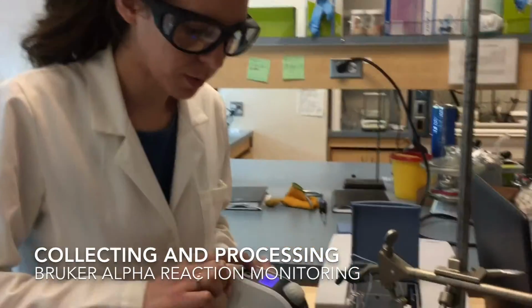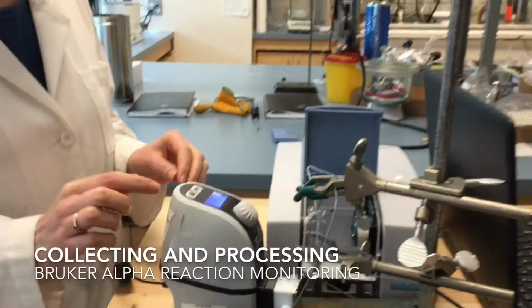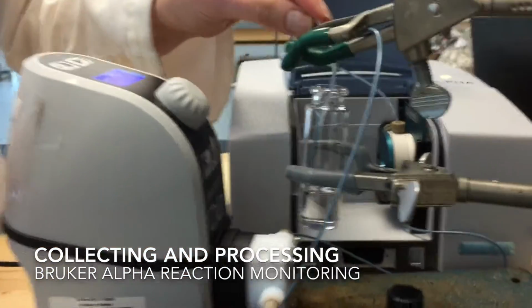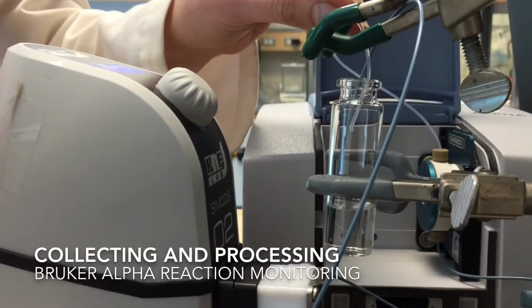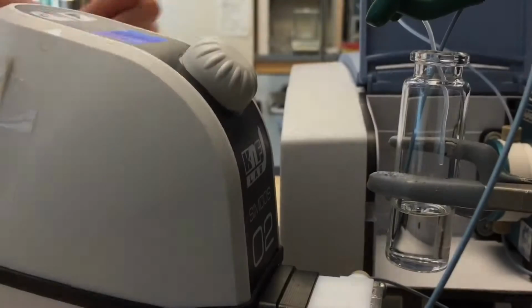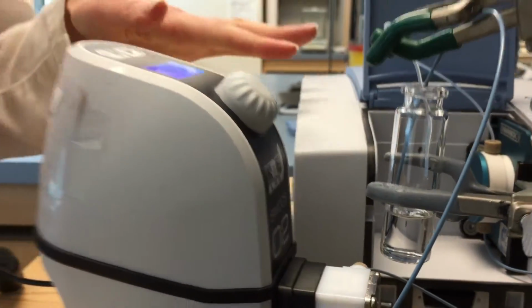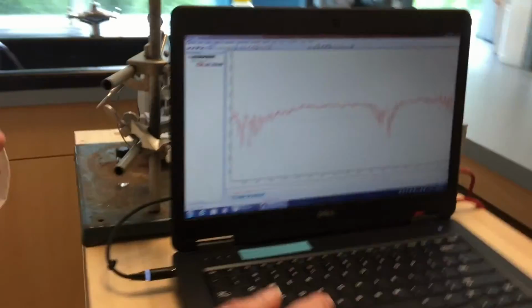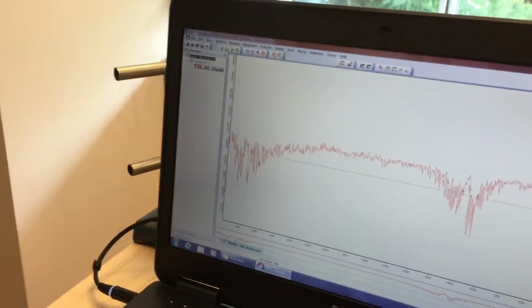Okay, so now I'm going to press play and we're going to see the solution flow through the whole system. After a few seconds, it started, and we can see there are drops coming through. While that is running, we can just continually circulate. This is just the background solution. So now we can tell this instrument here to do a background, and we're going to do reaction monitoring now.